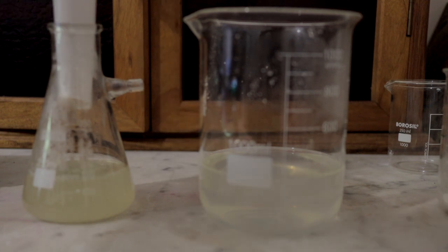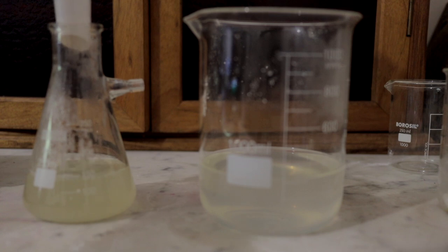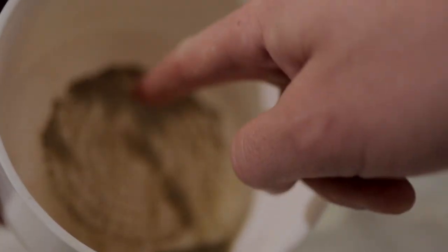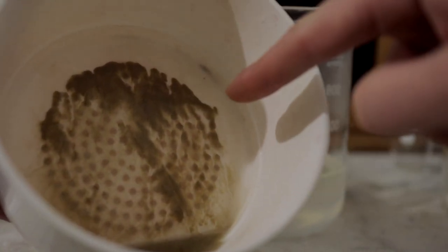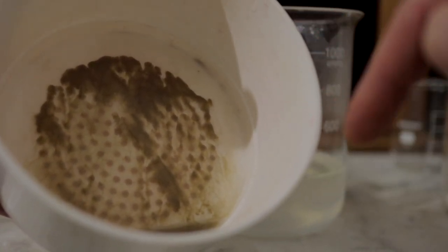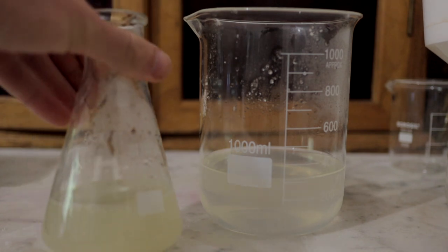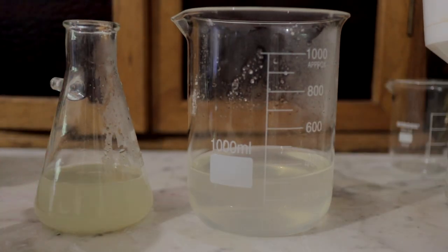If you don't have a large Büchner funnel and proper filter paper, you could use a coffee filter or cotton wool, although you won't get all the impurities out that way. As you can see there's a residue in the filter — some gunky material from the fertilizer — and that's mostly what we're trying to filter out here.